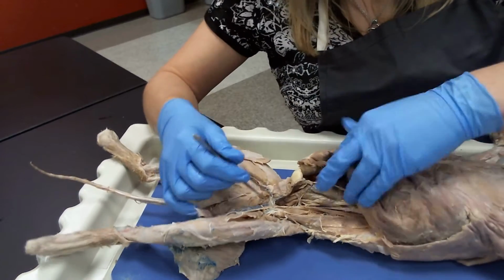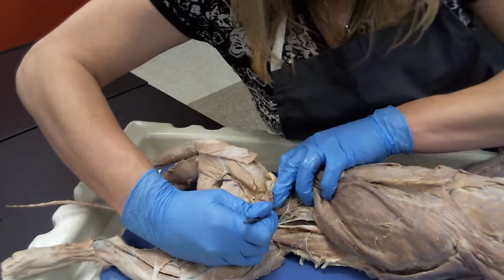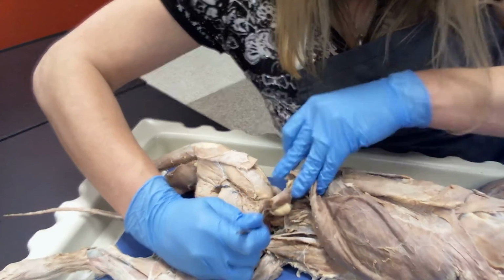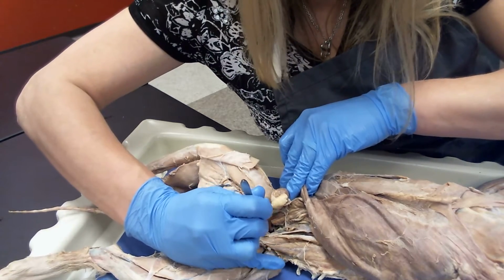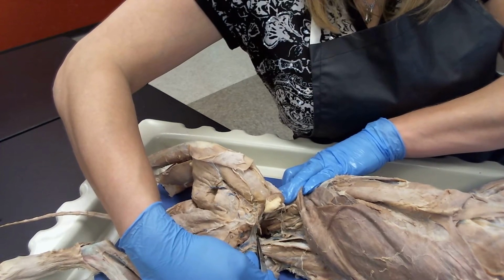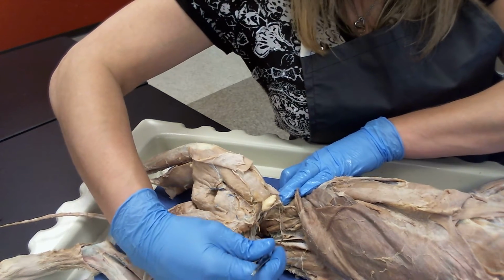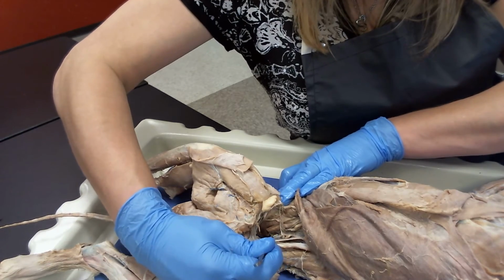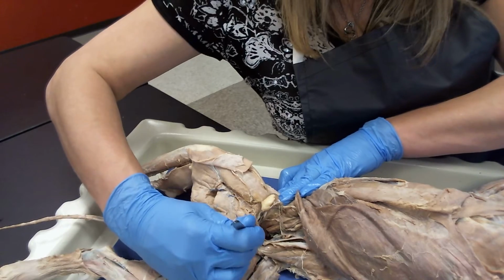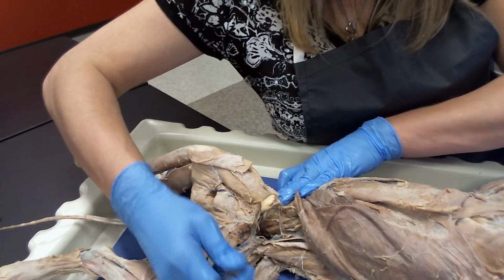All right, so now if we hold this cat open and look deep into the pelvic cavity, we're going to appreciate two different branches of nerves, okay? So this right here, if you look deep into the pelvic cavity, underneath the branches of the great vessels, your aorta and your caudal vena cava right here are going to be branching. If you're going to pull those out of the way, the first smaller nerve that you can see is your obturator nerve.